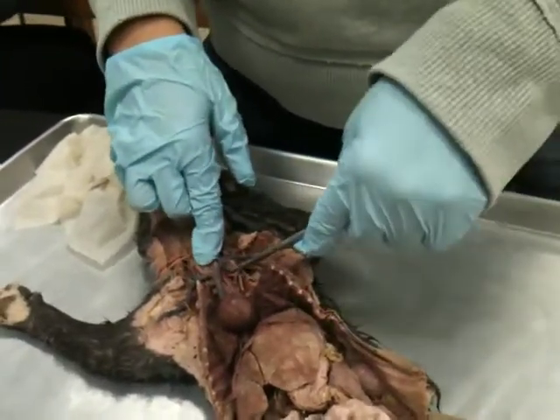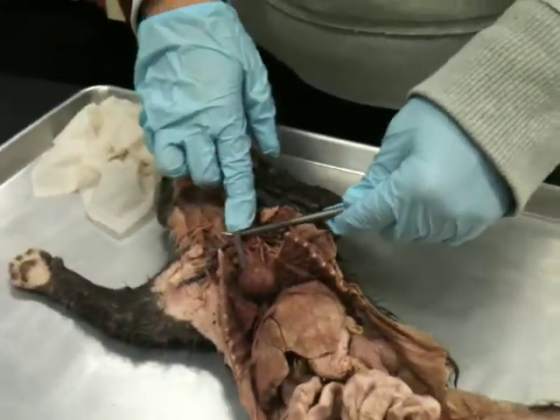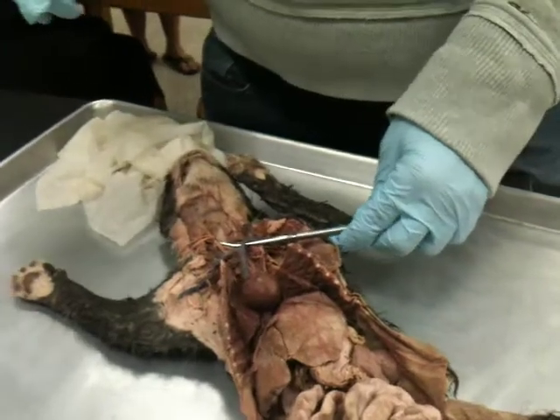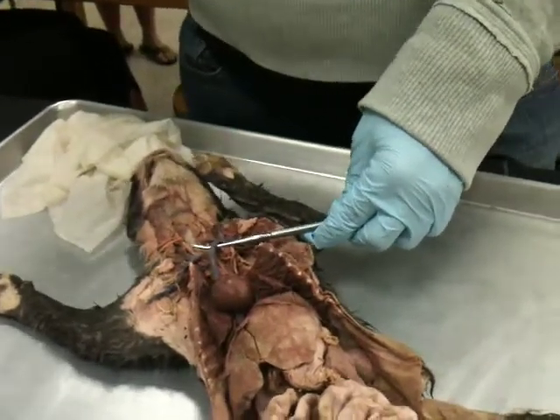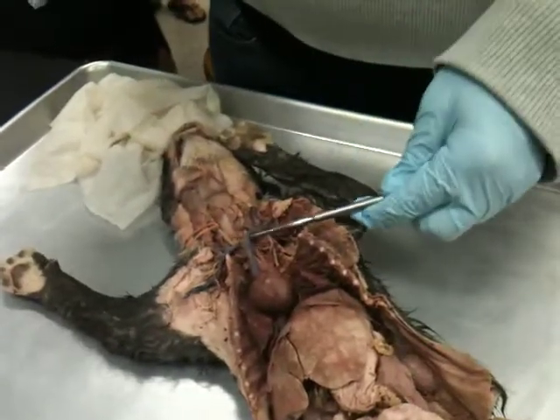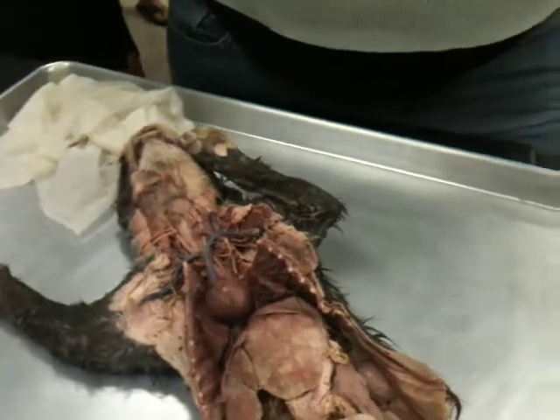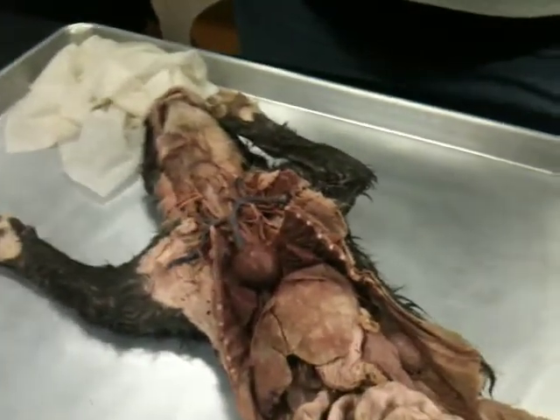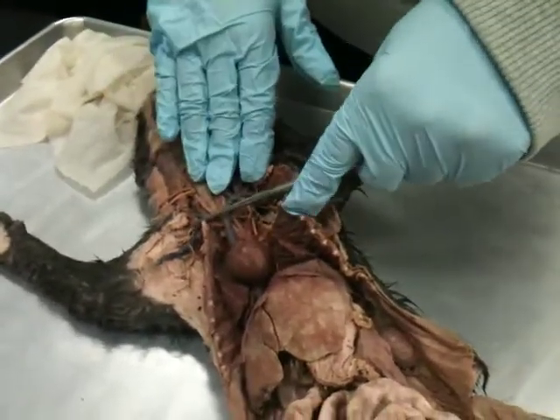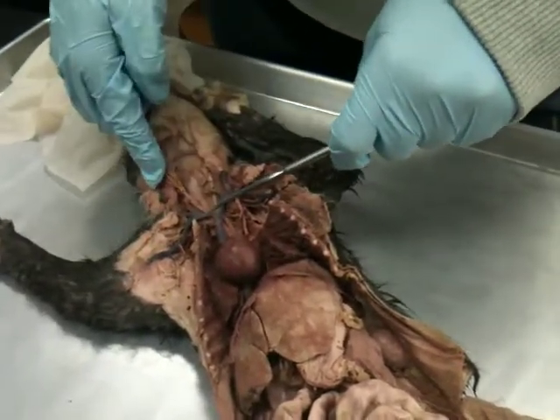But each of these small parts have a name. So we have a right and a left what? Brachiocephalic. Yeah, brachiocephalic. So you have a right brachiocephalic vein and a left brachiocephalic vein. And that name is telling you where the next two branches are going. Brachio refers to the arm, cephalic refers to the head. So if we follow that, we can see here we have a branch going into the arm and a branch going up into the neck towards the head.